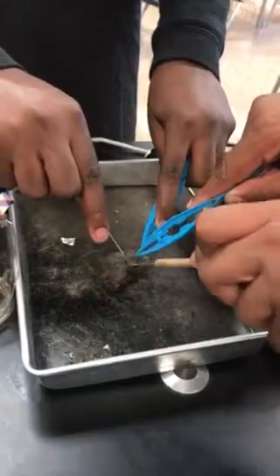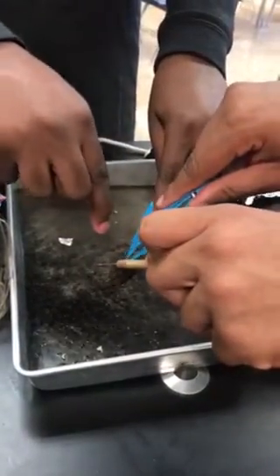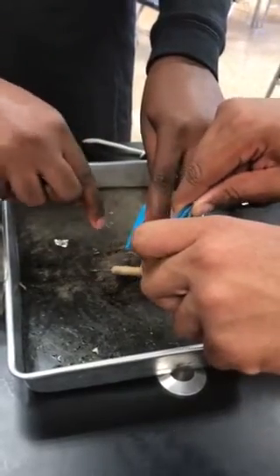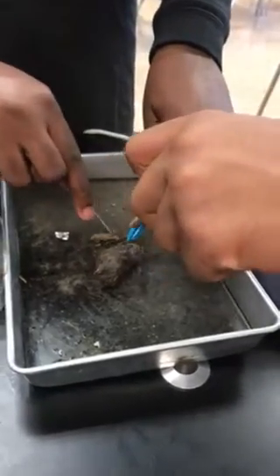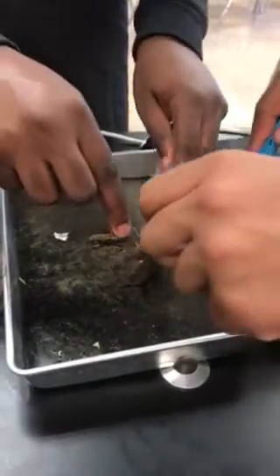There's a feather. Oh, this is tough. That's a piece of bone that came off, a jaw somewhere, like a jaw right here. A jaw? See if you can dig that out and see if we can identify it. It's this right here.